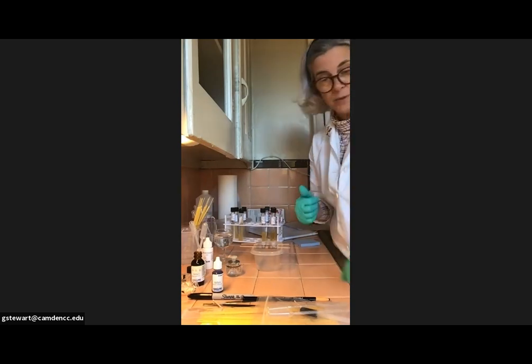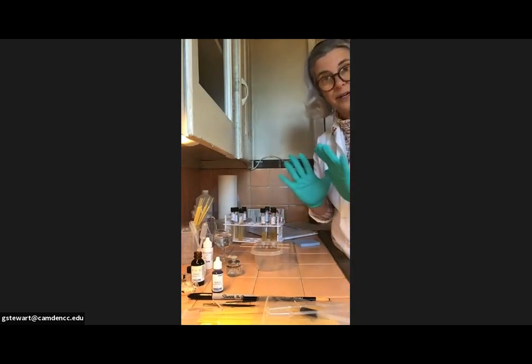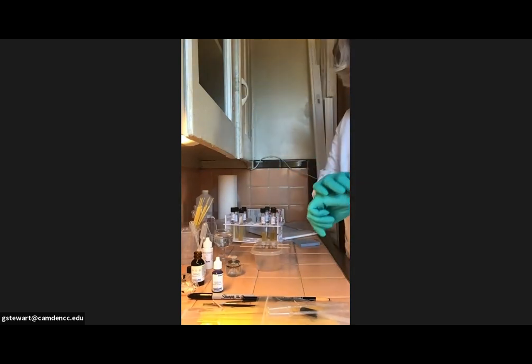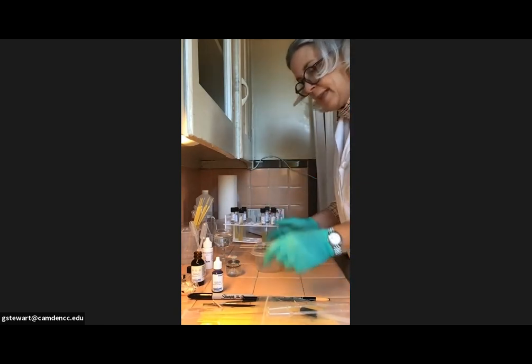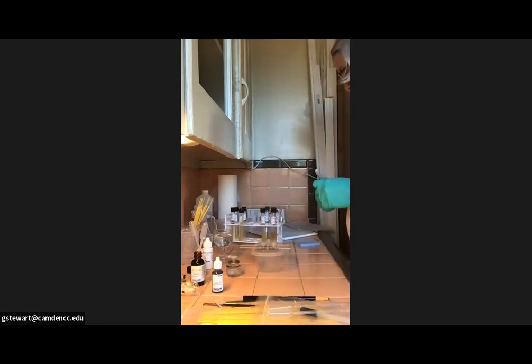And again, if you touch it with your pinky and your pinky hasn't touched any bacteria, it'll probably be fine. But I'm more comfortable just using my watch. So I'm just going to use my watch. Now, they recommend labeling the slides.